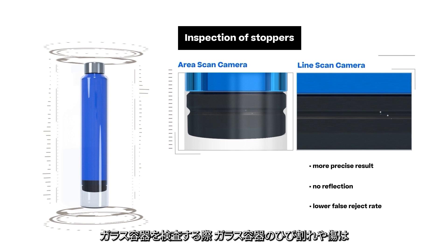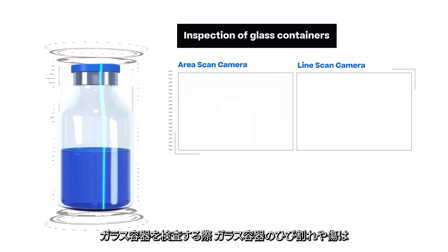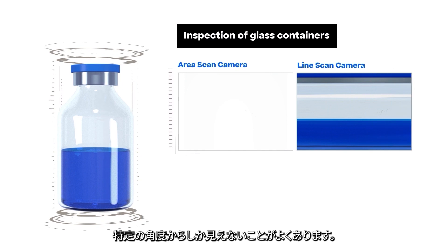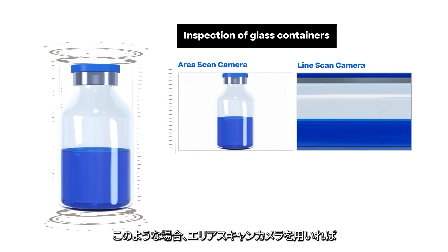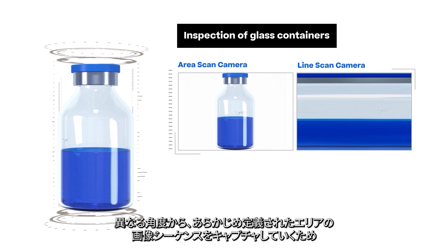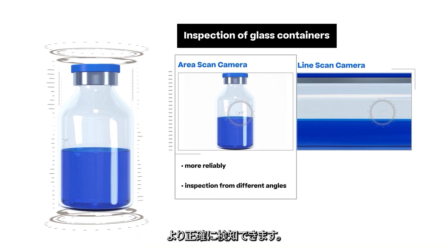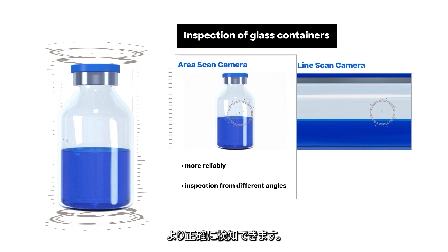When inspecting a glass container for cracks or scratches, such defects are often only visible from certain angles. With an area scan camera they can be detected more accurately because it captures image sequences of a predefined area from different angles.